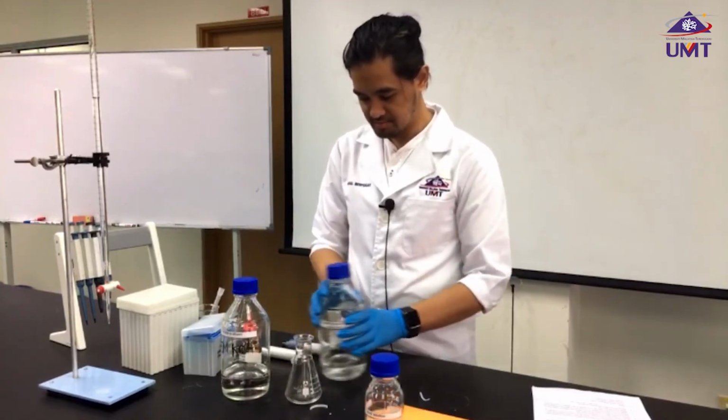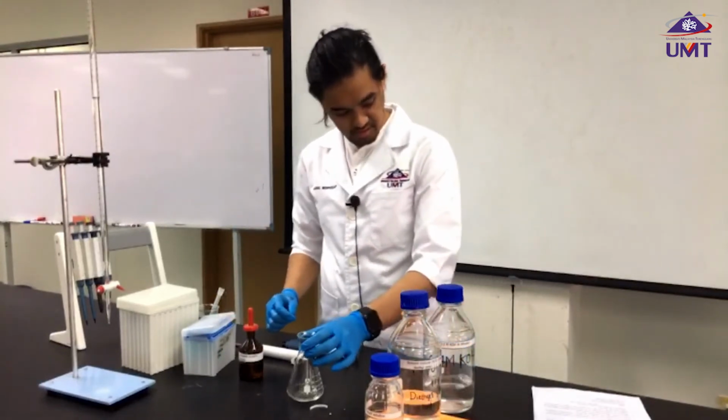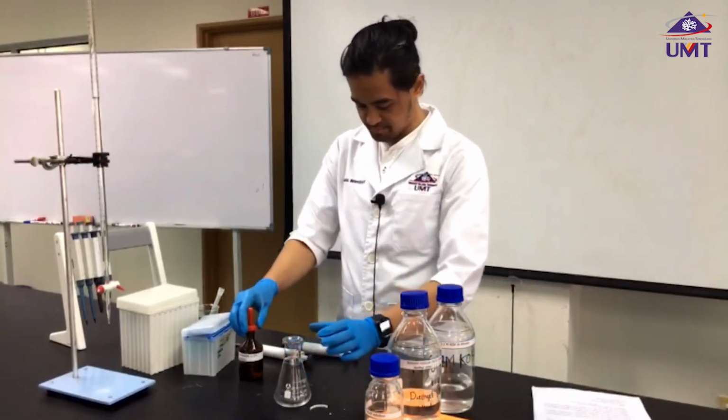And the last step is adding 5 drops of our indicator.